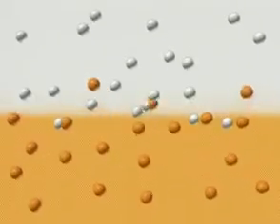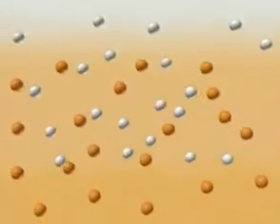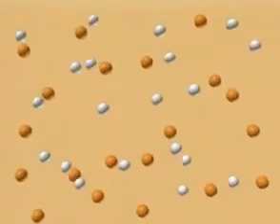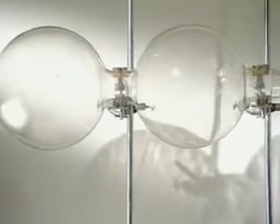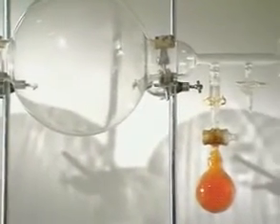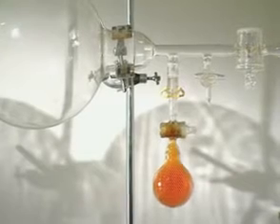It takes time because the air and the bromine molecules are colliding with themselves and each other. So what would happen if there was no air for the bromine to bump into? All the air has been removed from this apparatus, apart from the flask containing bromine, which is isolated by a tap.